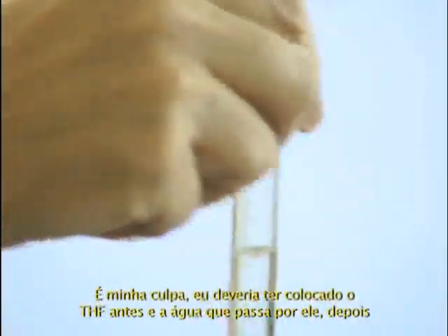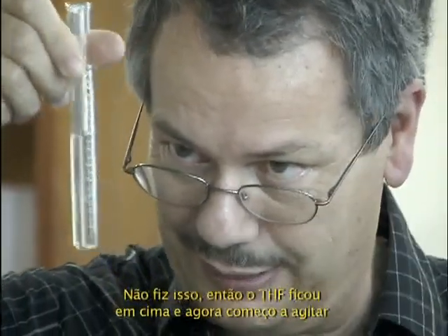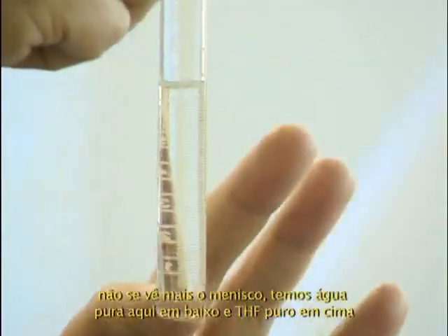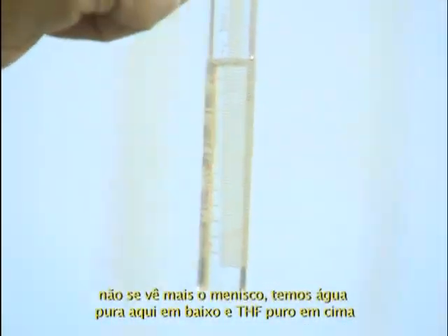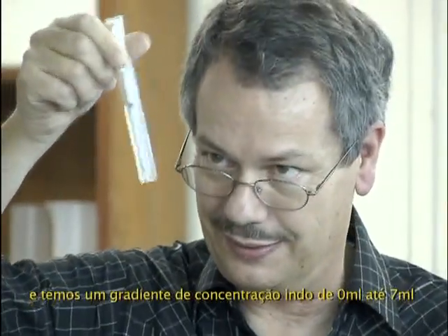That's my fault. I should put THF first and the water second. I didn't, so THF just went up to the water. And now I start to shake. You don't see any more meniscus, but you have pure water at the bottom, pure THF at the top, and you have a gradient of concentration going from 0 mL to 7 mL here.